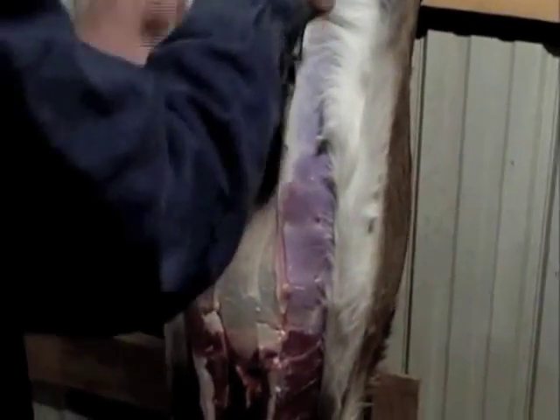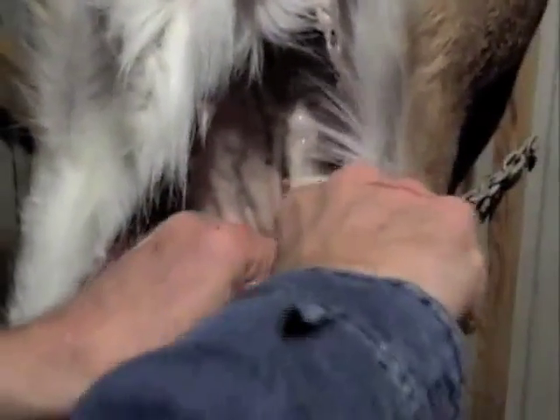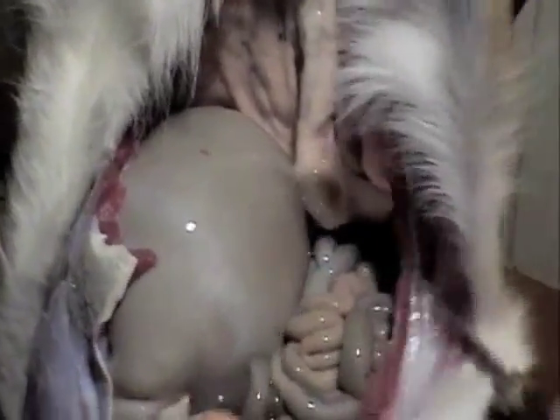I doubt that heart — if the bullet stayed in, all that energy stayed in, so it should have exploded. All right, the great thing is the stomach, there's the intestine. Daddy, point out the large intestine — on up to there.